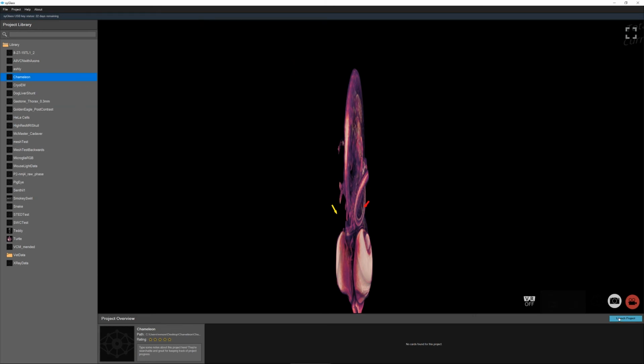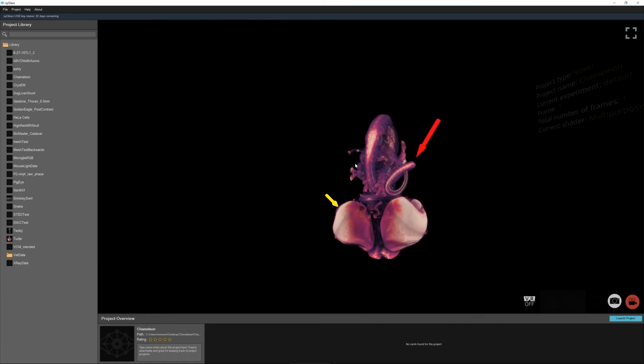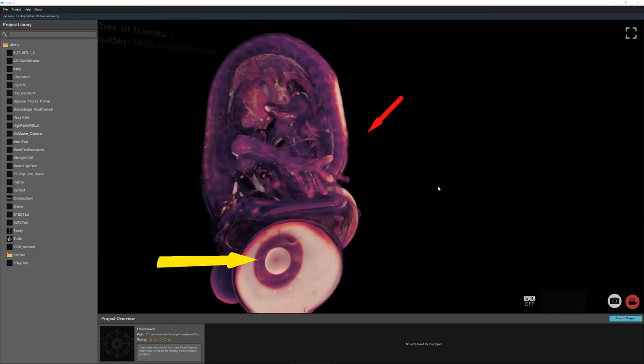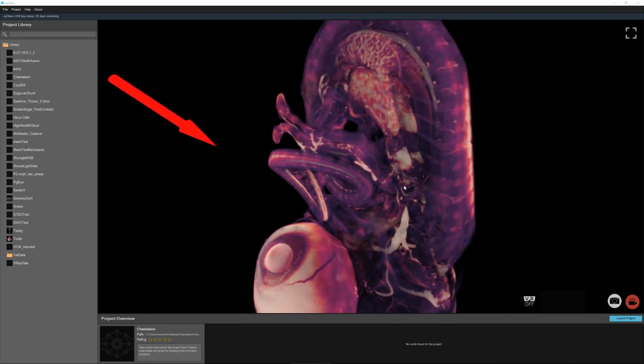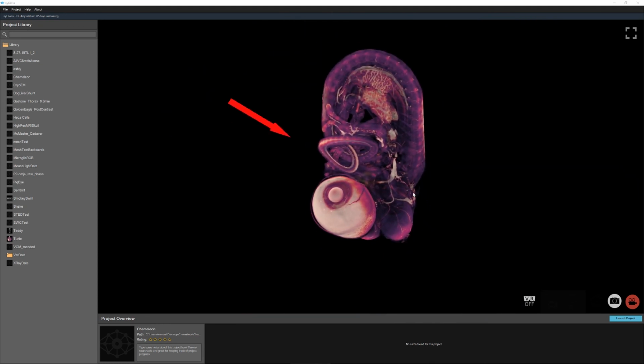When we reload this project now, the data is in the right proportion, and any measurement we make would be accurate. Thank you very much.